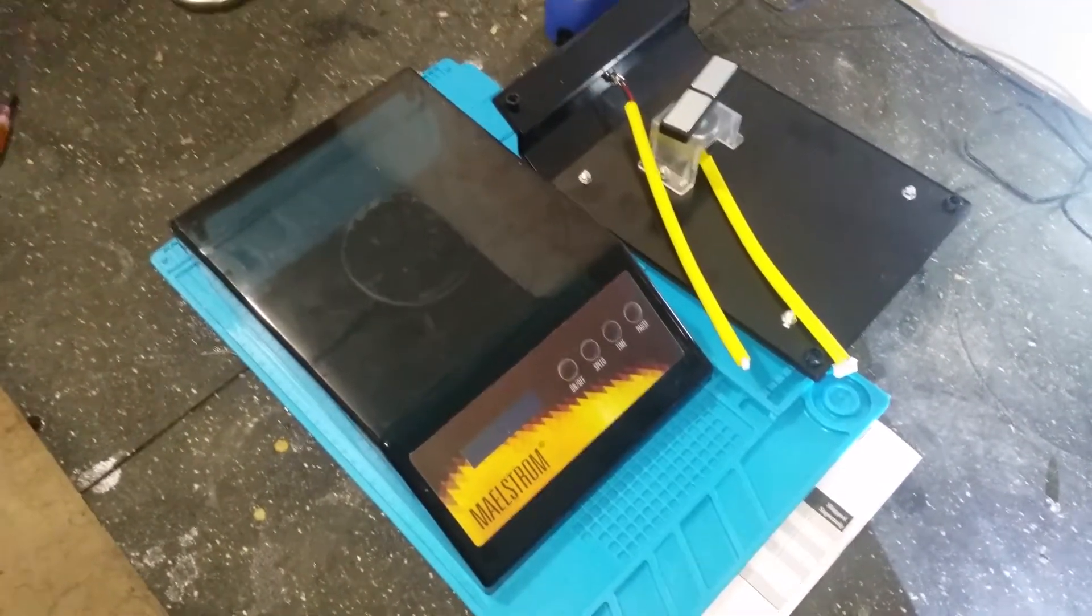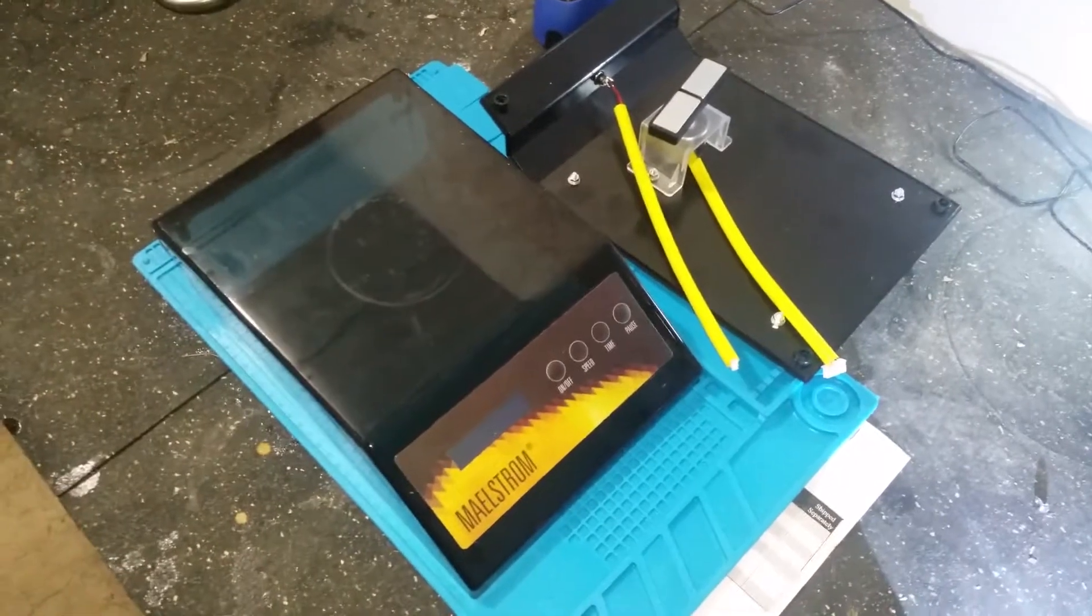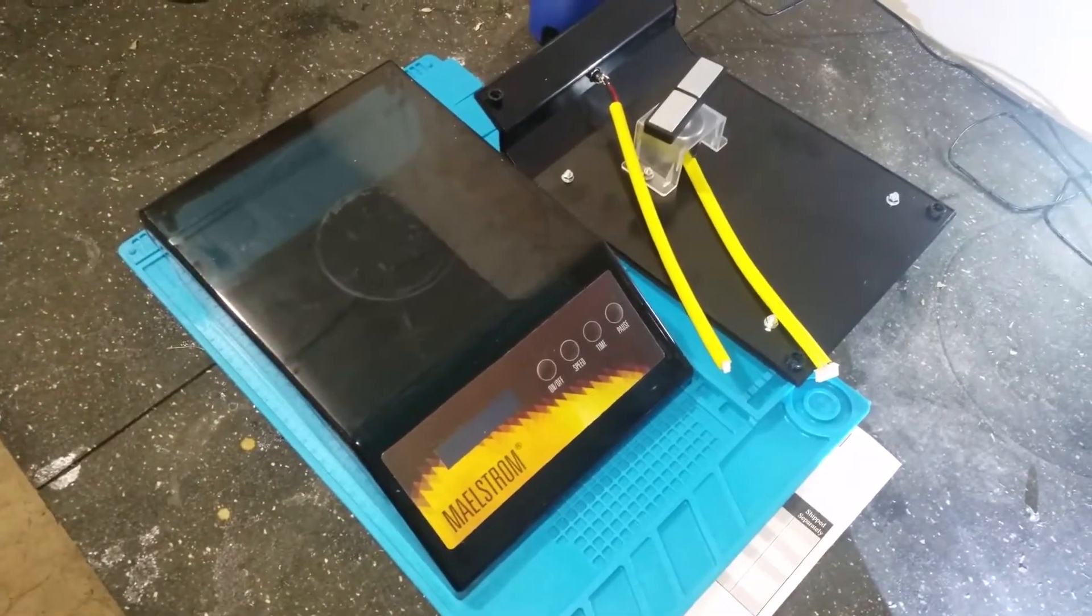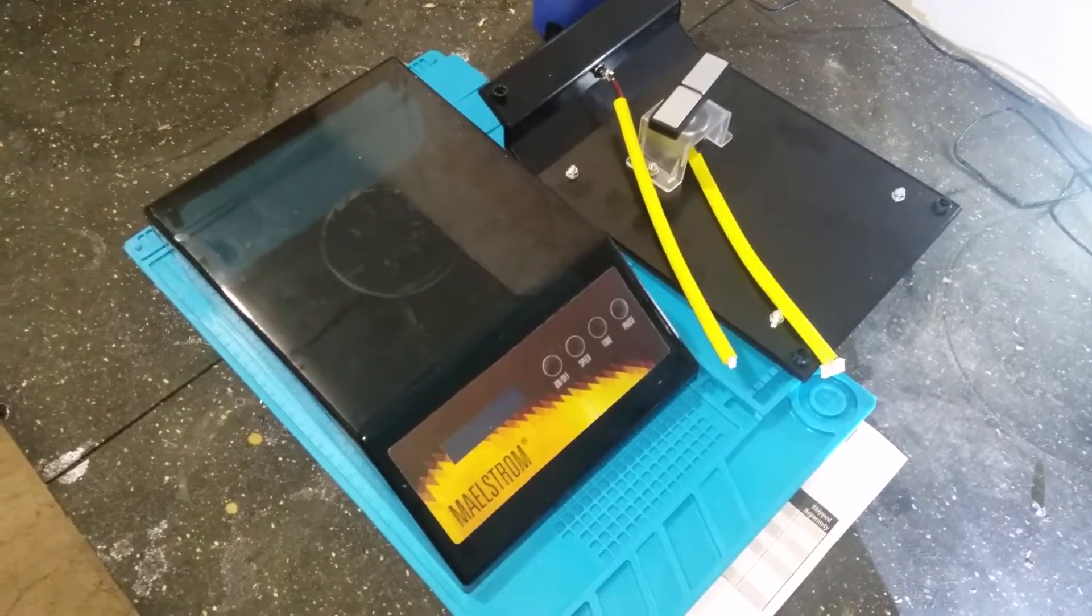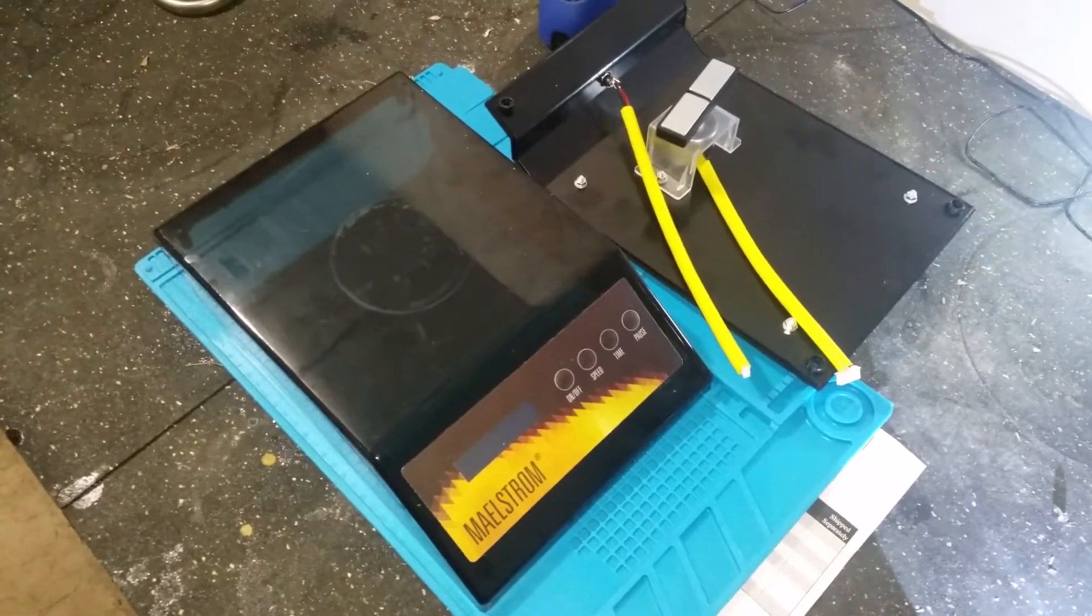So it started, I had a starter going and seemed to be working fine. I stopped it and it wouldn't restart.